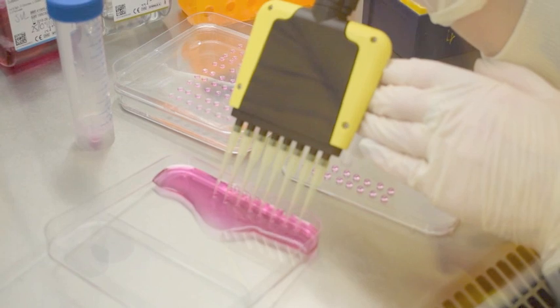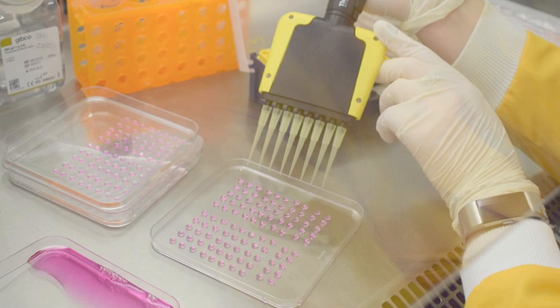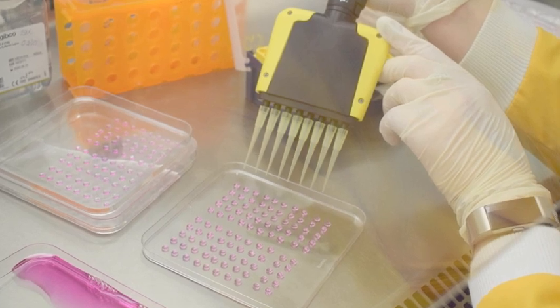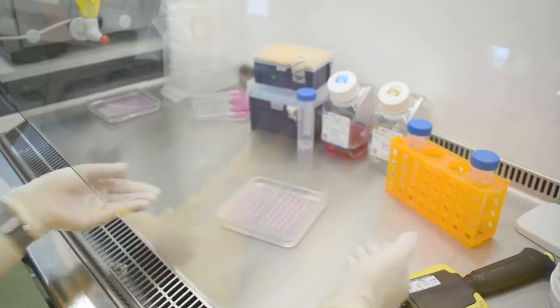Ensure not to position the spheroids too close to one another or too close to the edge of the plate. Carefully flip the lid and replace on the bottom of the dish.